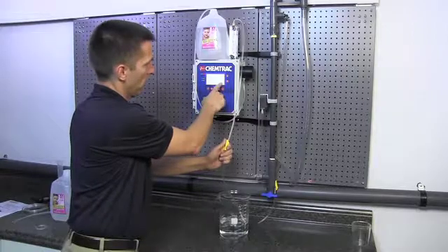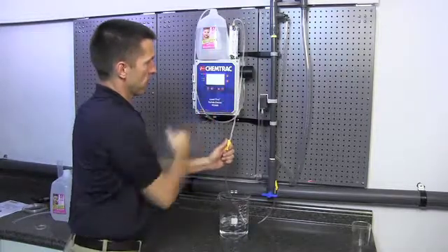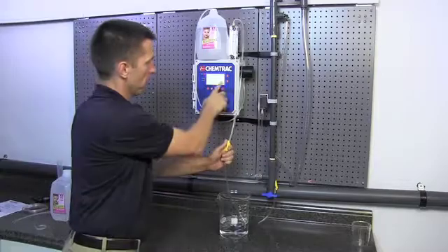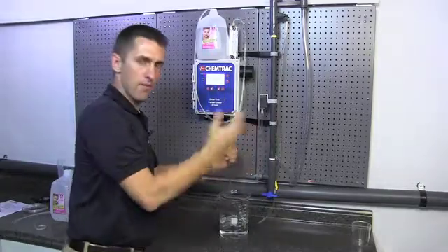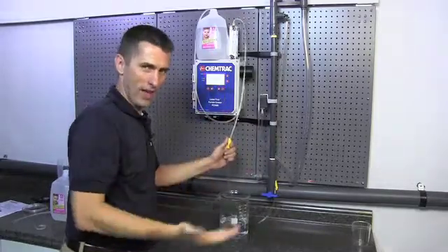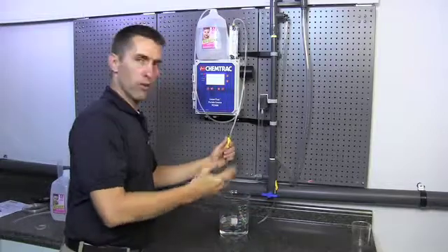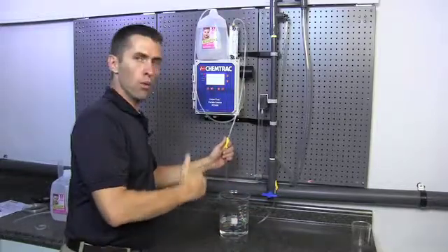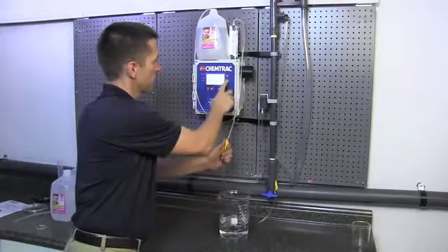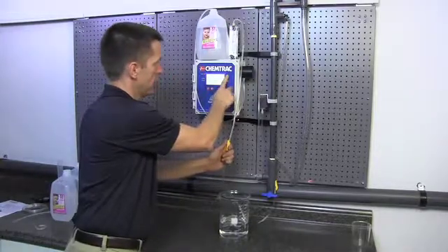One thing we want to check here is our cell condition and make sure that we are at that 95% mark or higher. In this case, we are. If it's not at 95%, if it happens to be at 93 or 92, that's still okay. But there is a procedure for adjusting the cell voltage. If it gets too low, we'll want to raise that up. Now, we'll go back to our counts page.